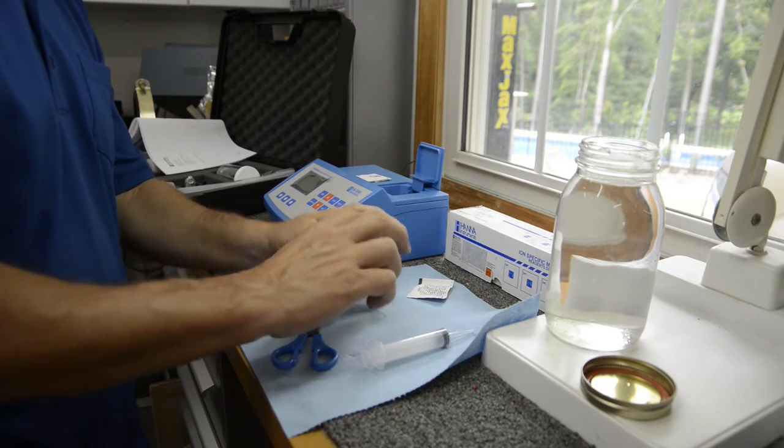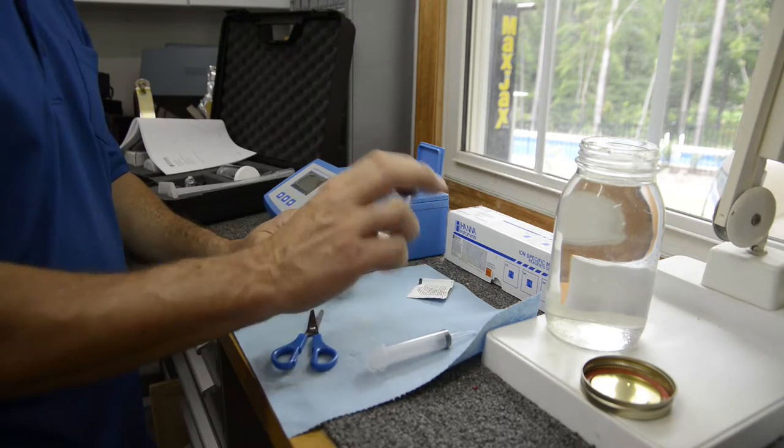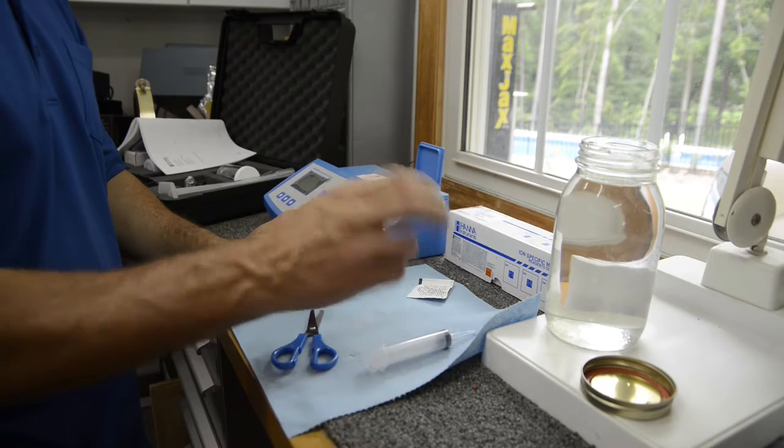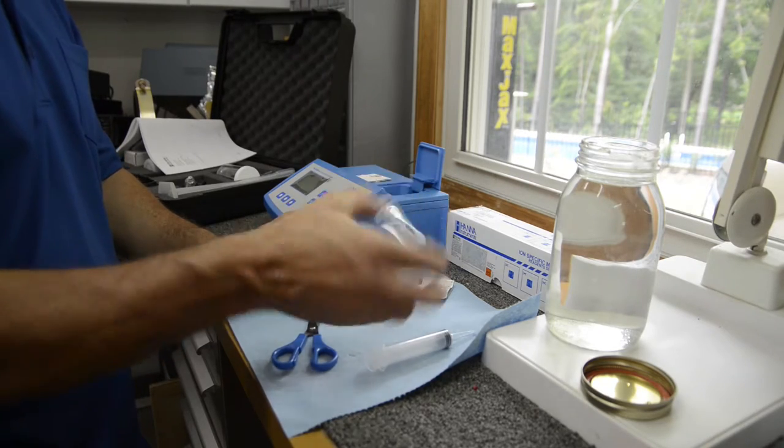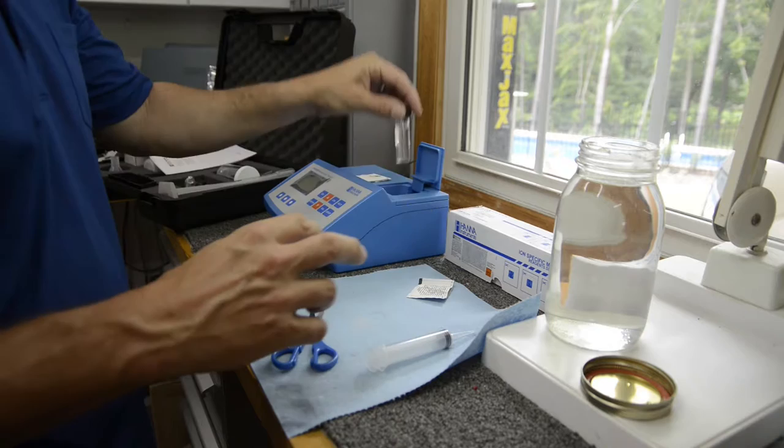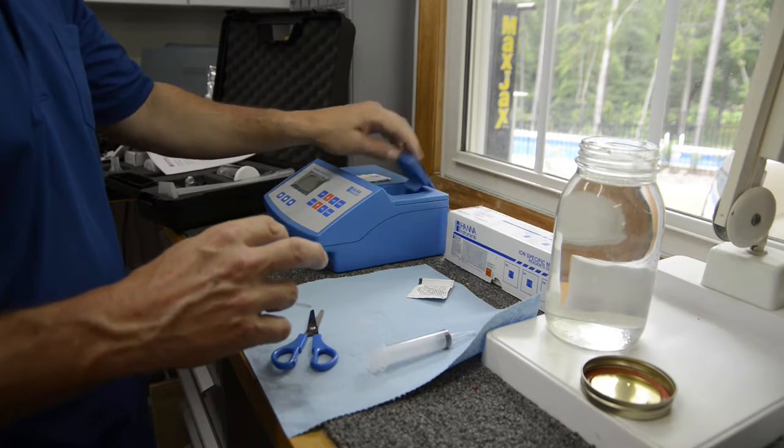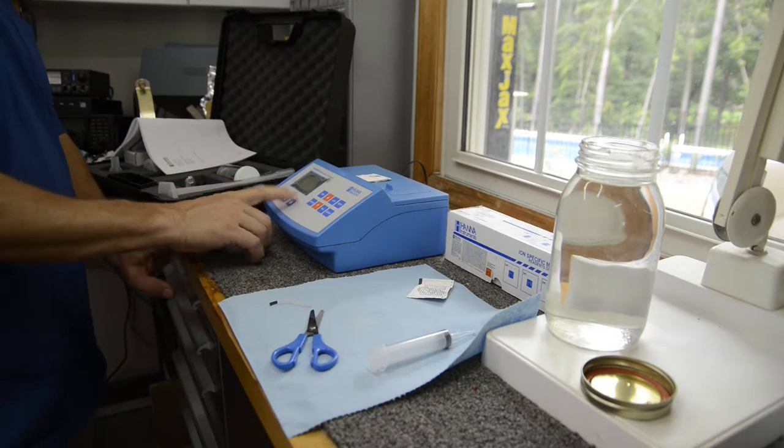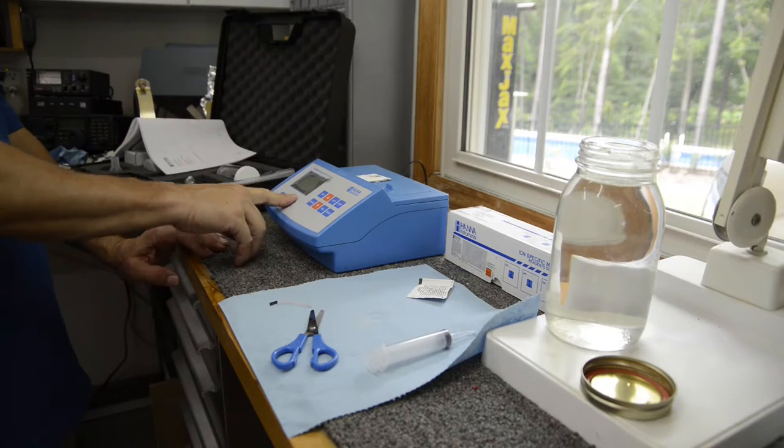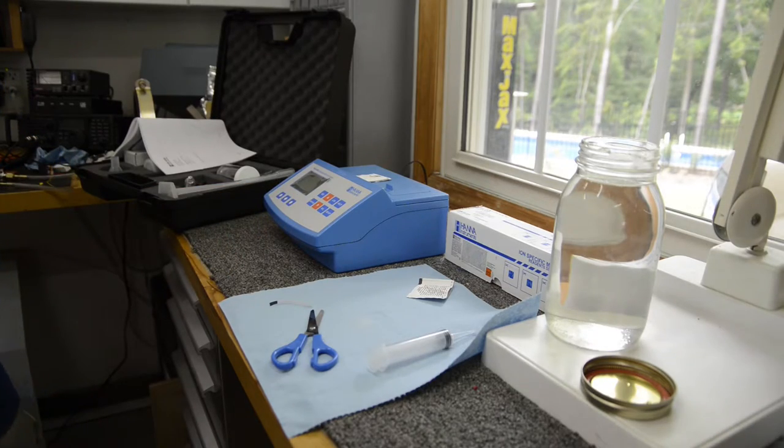Put the cap on. We just shake it back and forth gently - we don't want to introduce a bunch of air bubbles because it can give us a false reading. So just rock it back and forth. I'm going to put it in, press the timer, and in about four minutes we'll get our reading.